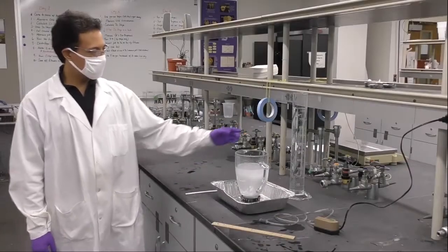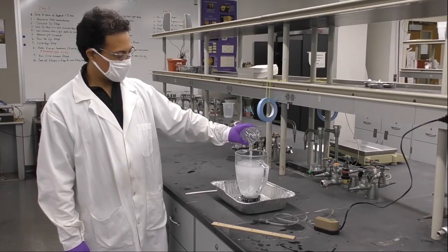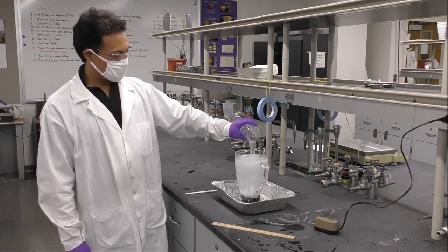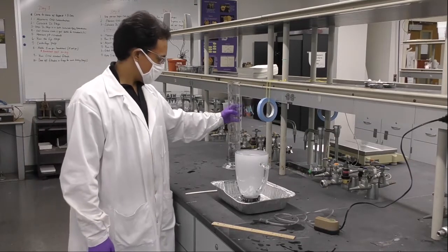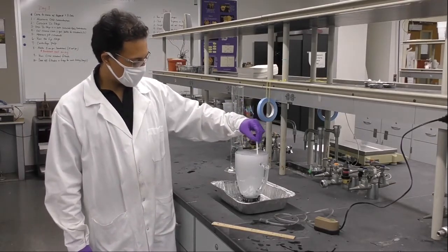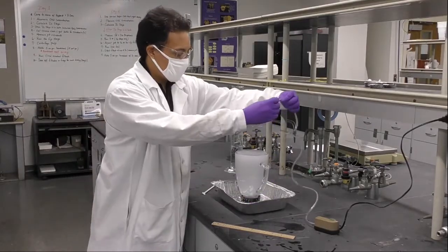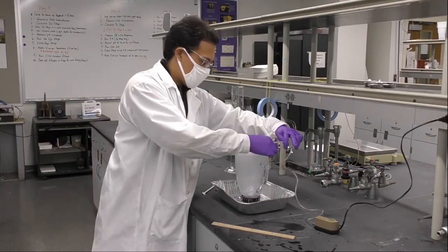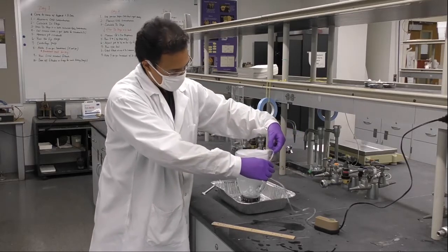Now we need to add cold tap water onto the top of the blender. Make sure that the level reaches the top. The next step is to introduce our air pump into the bottom of the blender to start generating the deinking process. What is going to happen is that we are going to blow some air and the bubbles will rise with the ink and our job is just to remove that ink from the mixture.